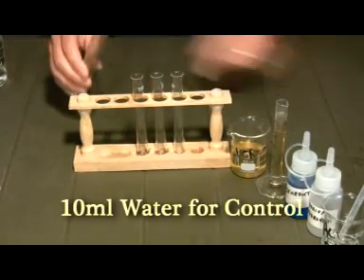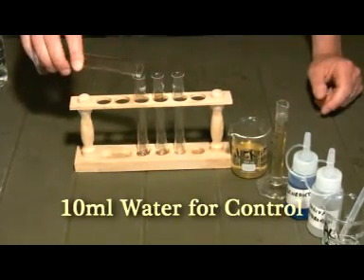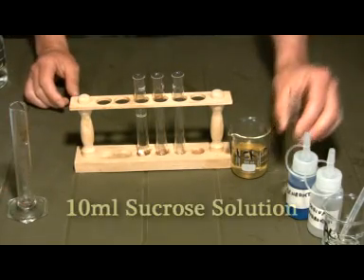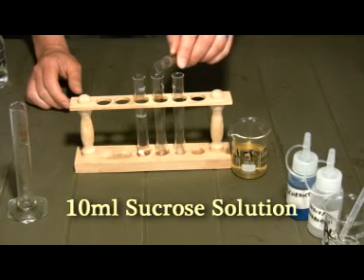Okay, let's add 10 ml for our test control, the water. Then we have our sucrose solution, 10 ml.